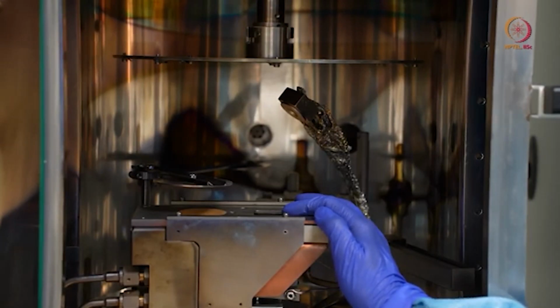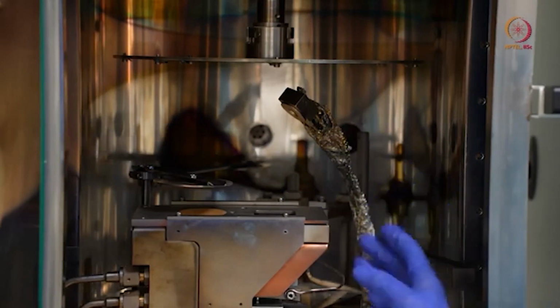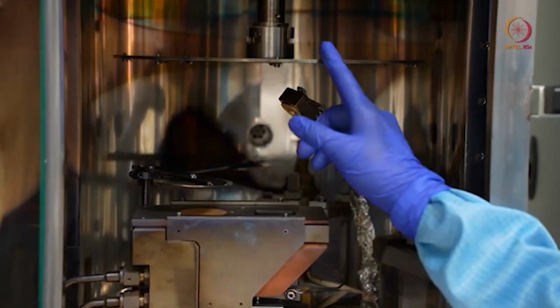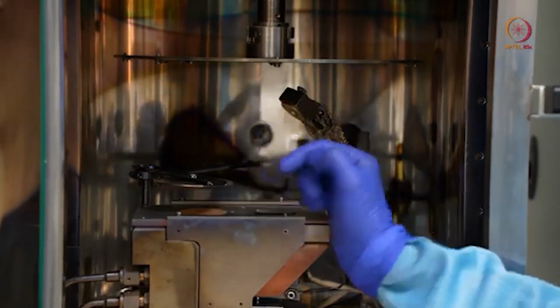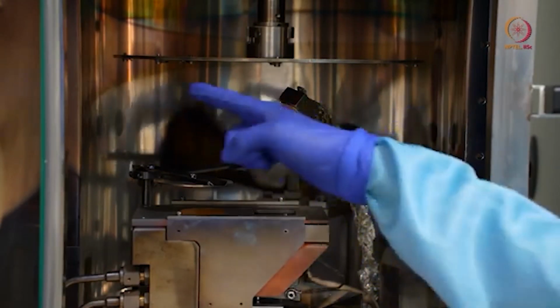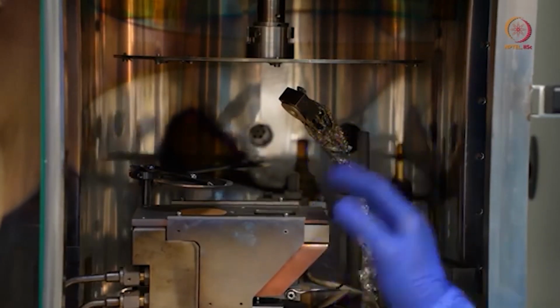You have to remember that when you are optimizing any tool. But in other cases, if you want to deposit some material like gold or platinum, some precious material, then you can prefer stationary mode depending on your sample size, and if there is only one wafer or something like that, and you don't want to waste material all over the chuck, only if you want to deposit here, then you can go for it. That is your choice.